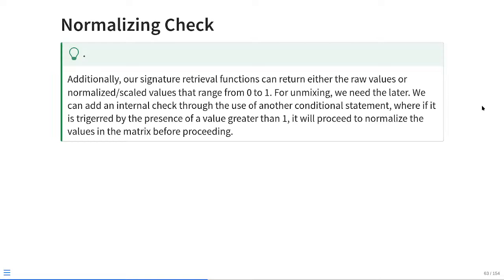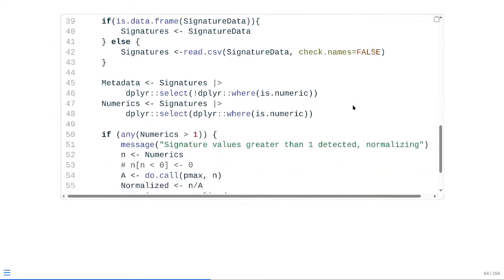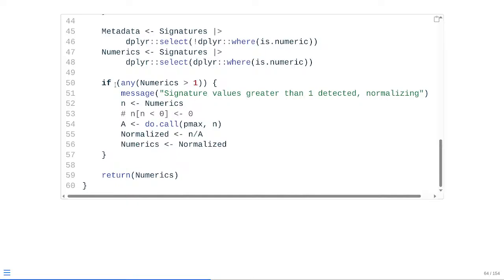And let me double check before proceeding. Yep. So what this is going to look like in actual practice, as you can see, is if any of the values within numerics is greater than 1, at that point it's going to evaluate as true, and it's going to proceed to within these little curly brackets. And then first it's going to message you to let you know, hey, it found values that were not yet normalized. It's going to start normalizing them, just in case this was an error. And then it's just copying and pasting in the code that had been used for the spectral signatures lesson as far as the actual scaling normalization process. Obviously, if the values have already been scaled, it doesn't need to rerun this line of code. So at that point, it would just not actually be evaluated.